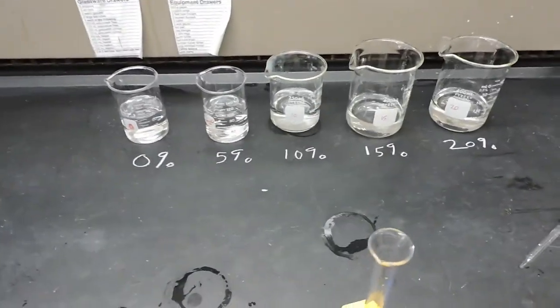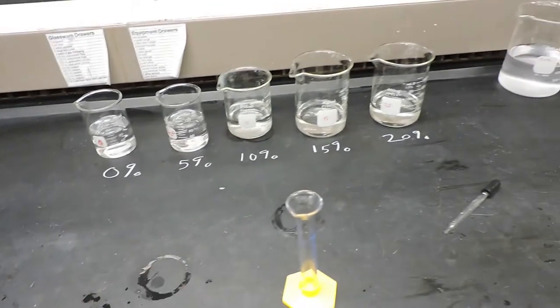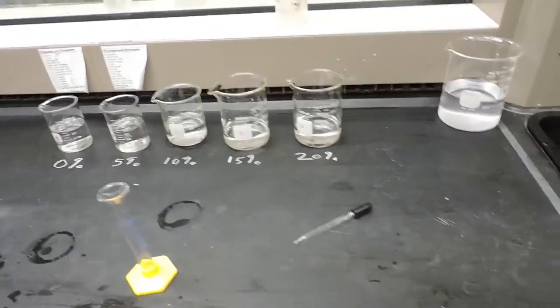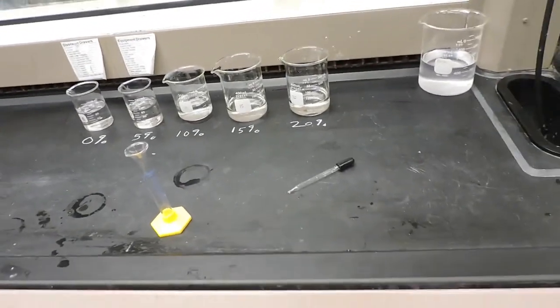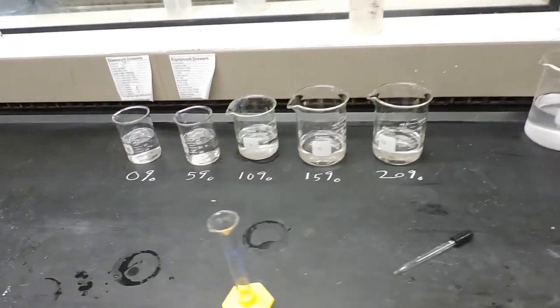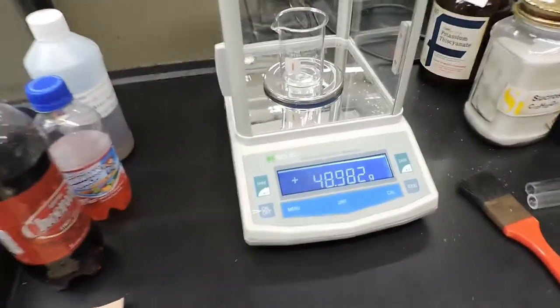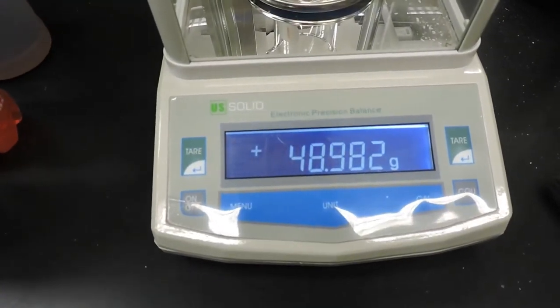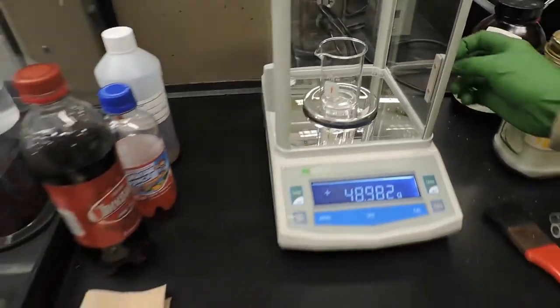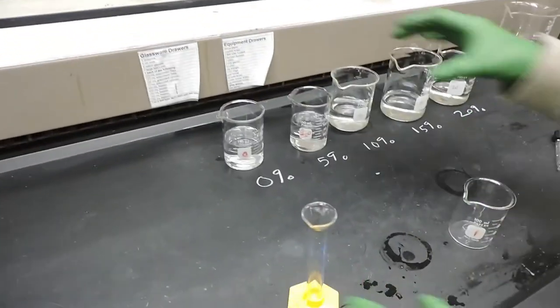Now that we have these standard solutions, we're going to take them and weigh 10 milliliters of each solution to find their density. And this will help us establish a calibration curve. So here we have a beaker. We'll find this mass, which is 48.982 grams. To this beaker, we will add 10 milliliters of a stock solution that we made.